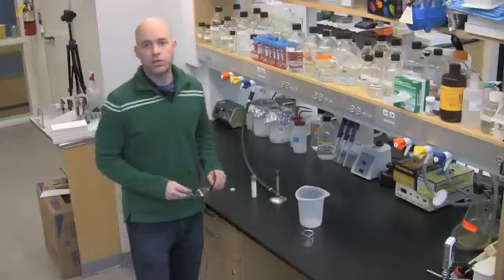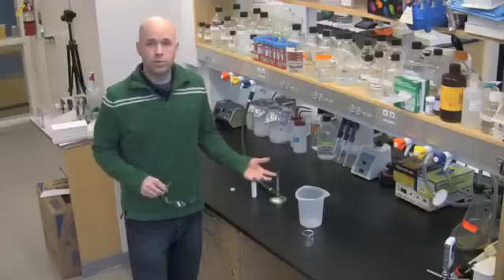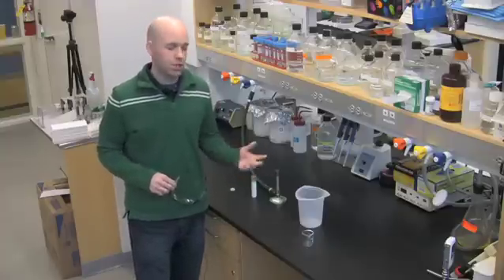Alright, so when pulling capillary tubes, I generally throw on some safety glasses. There is a step where we're going to be breaking some glass, so you just want to be sure your eyes are protected.